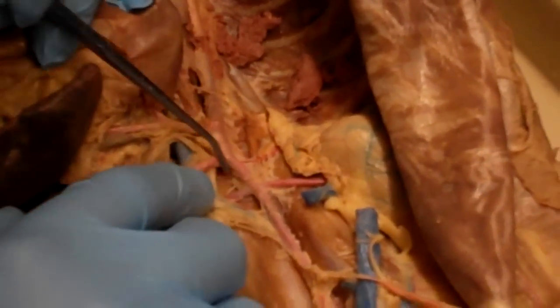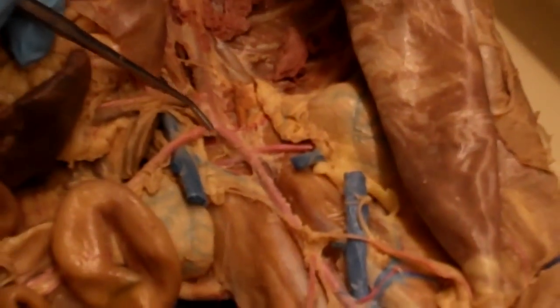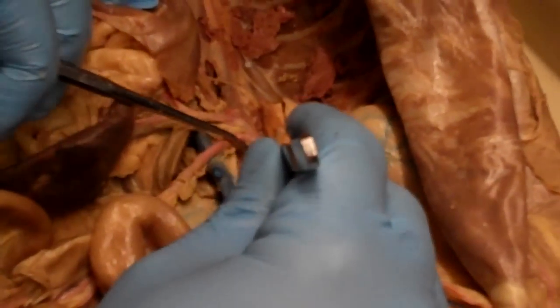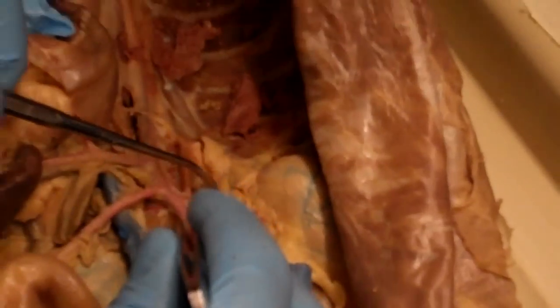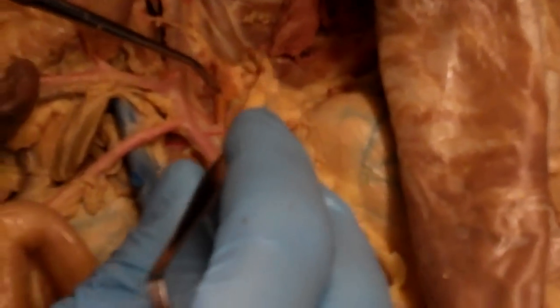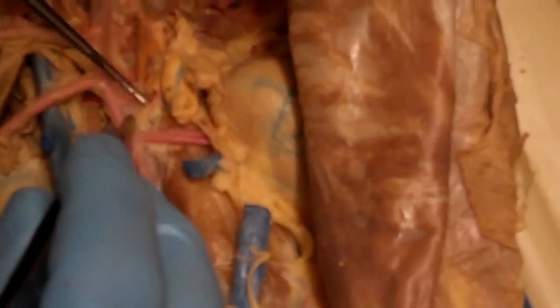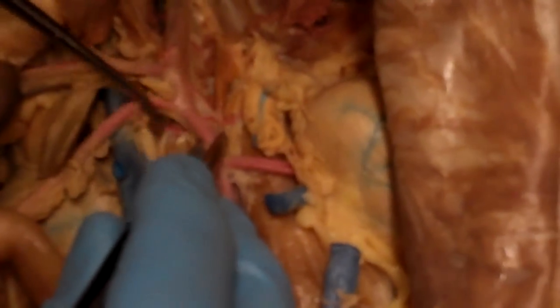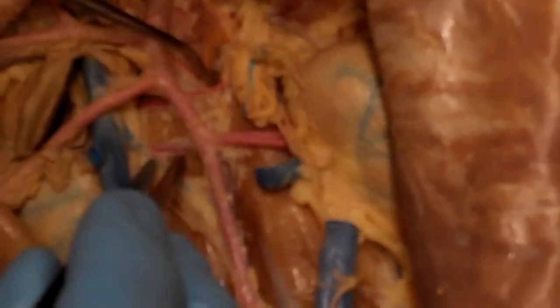You can see they're very small, but there's two paired vessels just next door to the superior mesenteric. You can see there's one right there and one right there, and that's going to be the adrenolumbar arteries. This is the remnants of the adrenal gland right here, but they just course right to those. So these small paired vessels, left and right adrenolumbar arteries, are next.